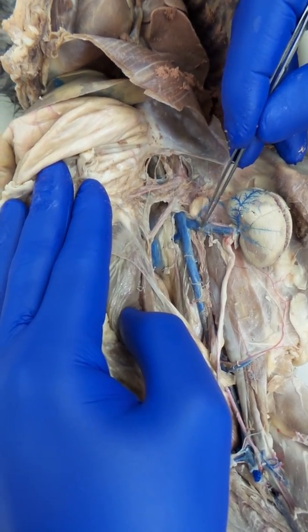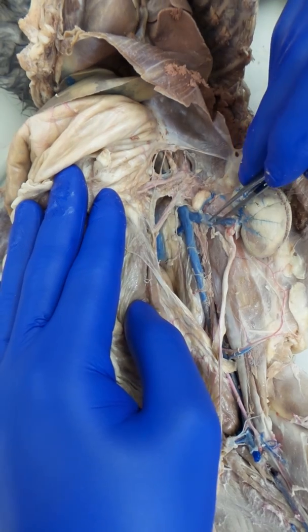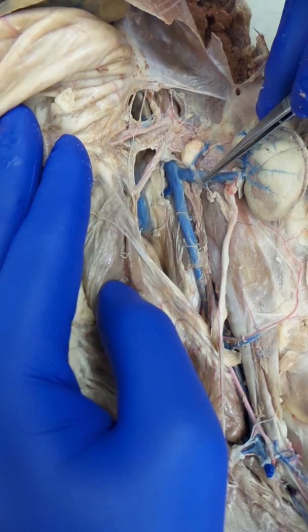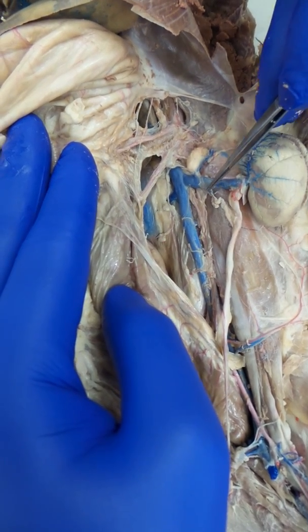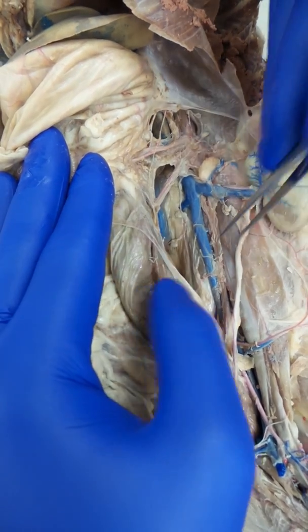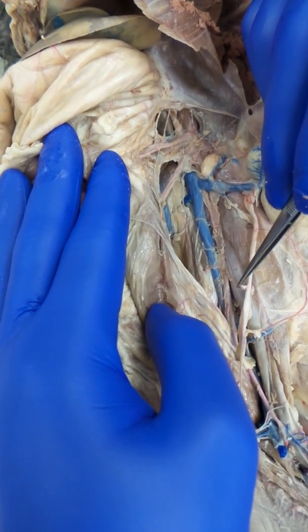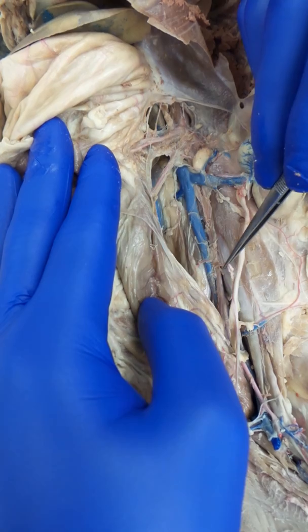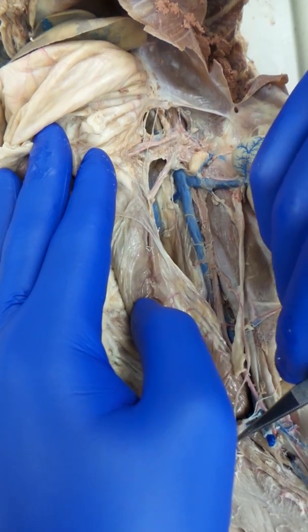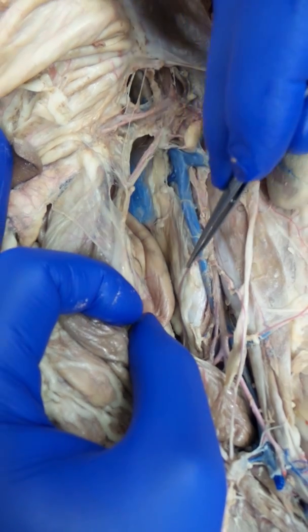So that brings us to the renal vein and the renal artery running over here to the kidney. You can see this little nub right here — it didn't perfuse real well — but that's actually, in this case, since it's a male cat, the spermatic vein, which runs right down here and would run down with the ureter. As far as the artery goes, working our way down the abdominal aorta, right here you can see the spermatic artery. It comes over, attaches to that ureter, and runs down into the spermatic cord. On the other side, there's the right spermatic artery, still intact a little better.